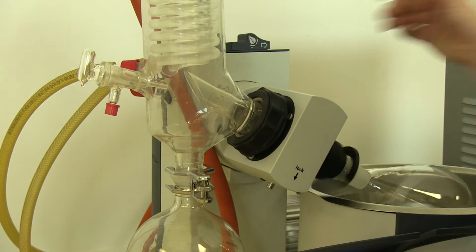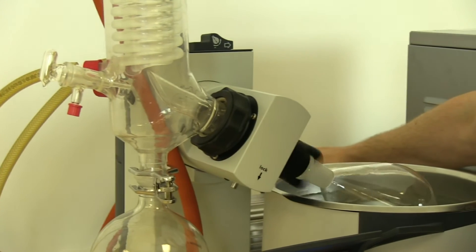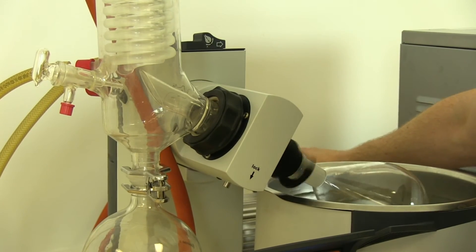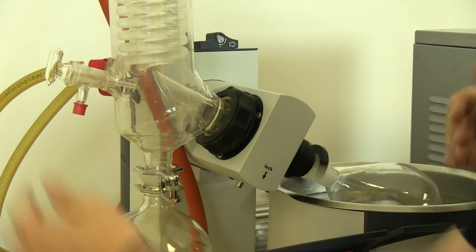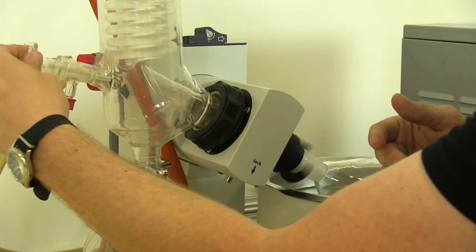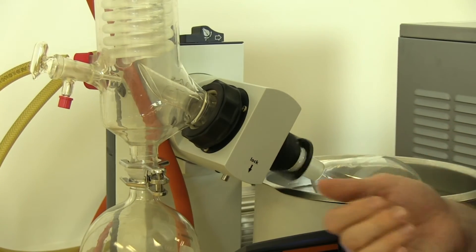You can hold vacuum by rotating it so that these holes do not line up. We can break vacuum. We can shut the vacuum pump off to break vacuum that way as well. And as you can see, if you can easily remove it, you've broken vacuum.